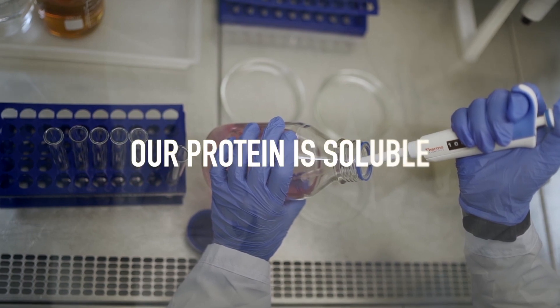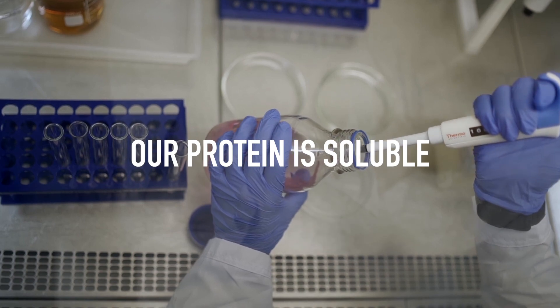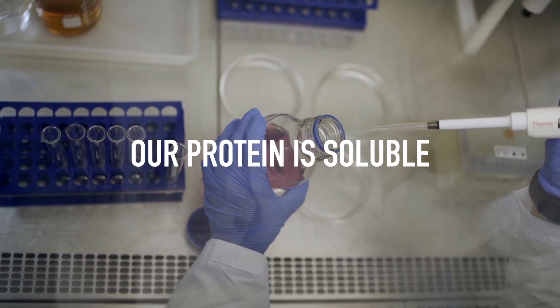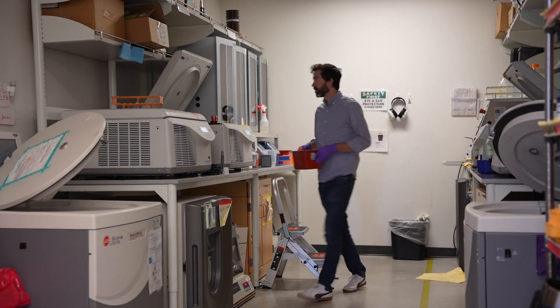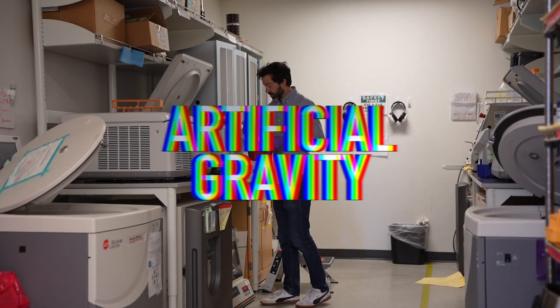Our protein should be super soluble, so it's not going to settle down to the bottom, even if many of its insoluble neighbors do. Now, instead of waiting for Earth's gravity to do the work, we have another machine in the lab that can create some artificial gravity for us.